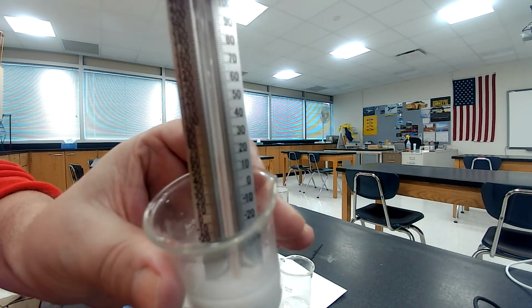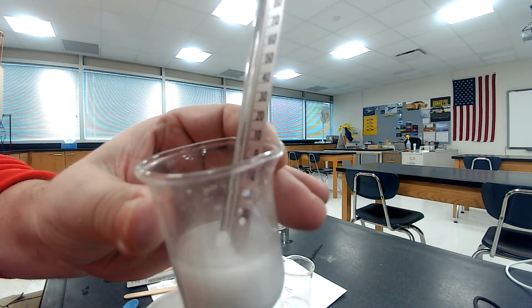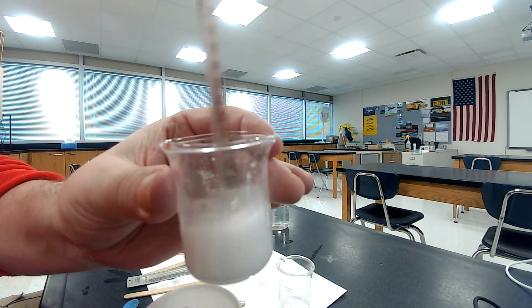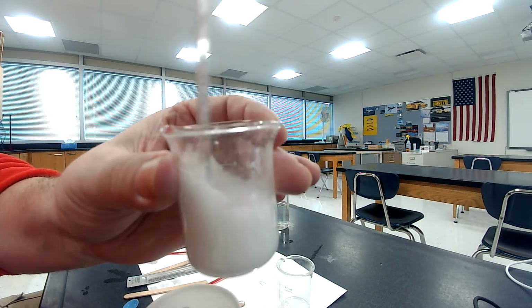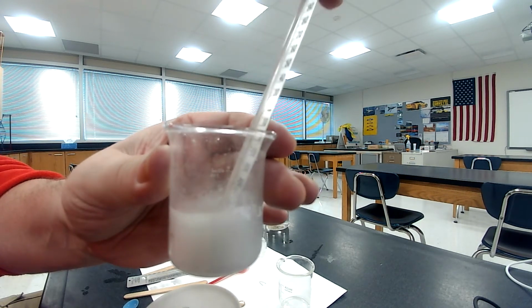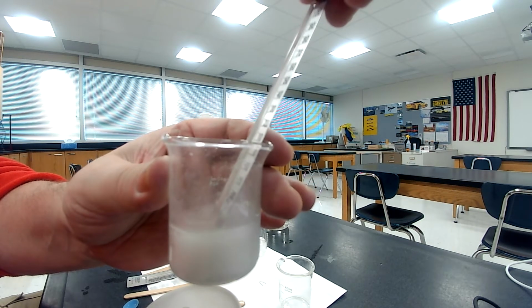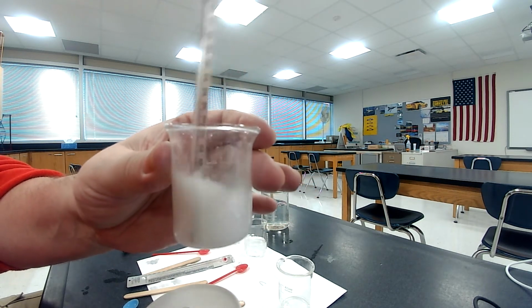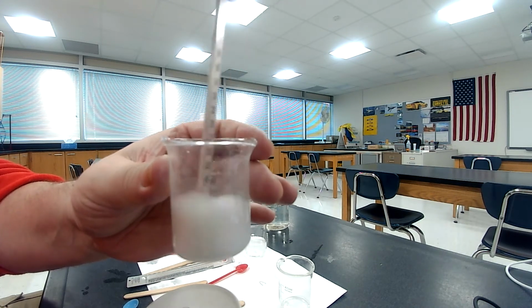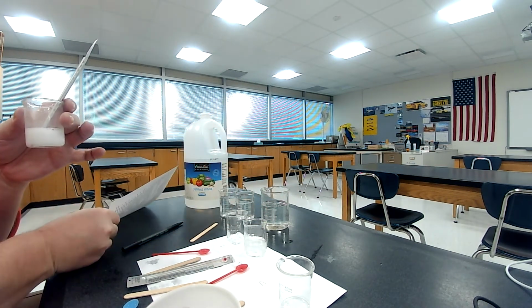Oh, it's fizzing. You can see it fizzing in there. See that? Nice. Oh, it seems to be getting more vigorous. Okay, I'll keep stirring with this. Look at it, it's a little bit more vigorous. Okay, we'll let that go for just a minute here.